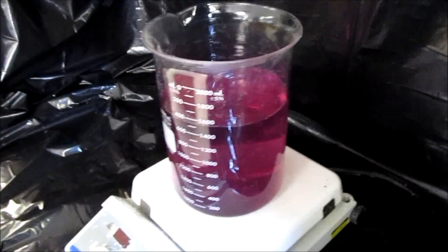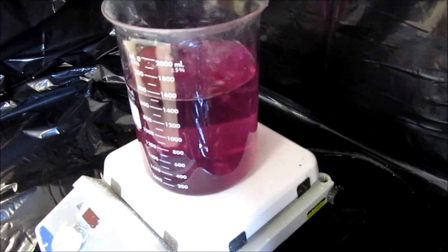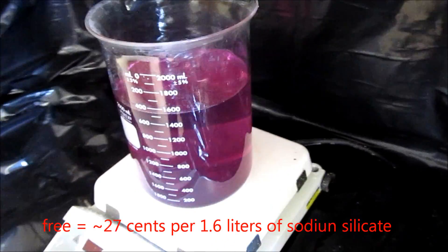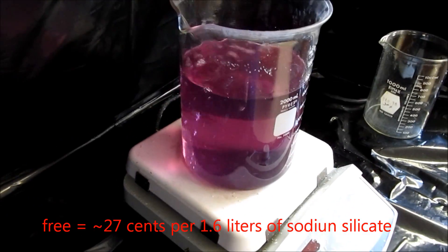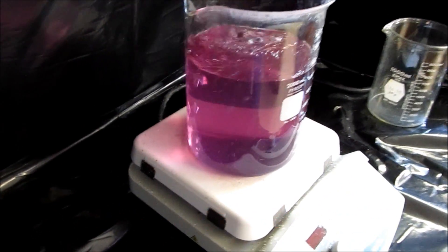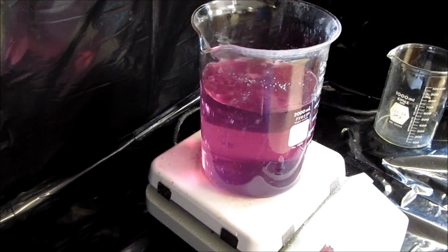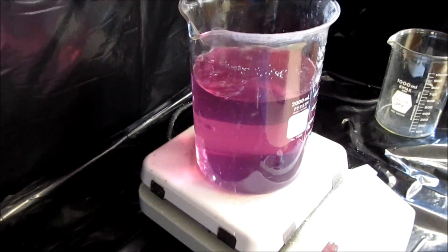I can use about $10 worth of kitty litter. Sodium hydroxide is free, of course, getting it at a water plant. And then I don't know how much electricity, but with $10 worth of kitty litter, I make about $100 to $150 worth of sodium silicate.